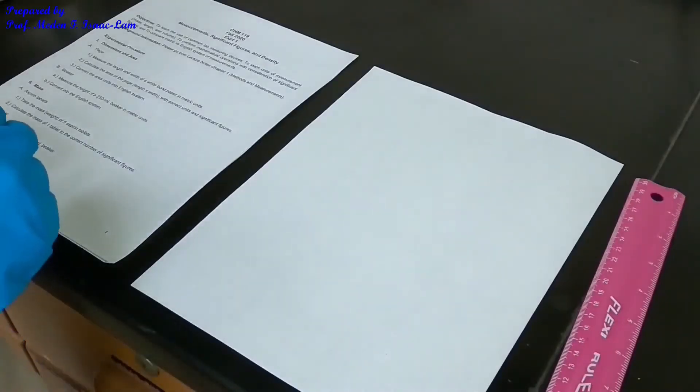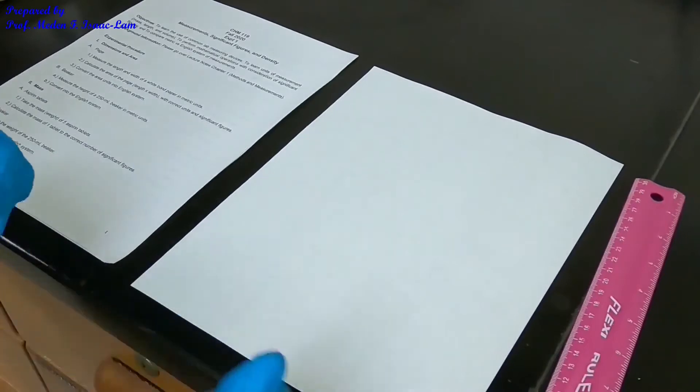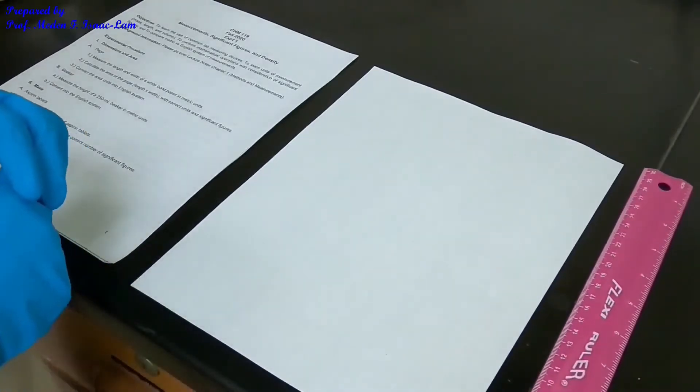This is experiment one: measurement, significant figures, and density. I'm going to start with the first one, which is dimensions and area.